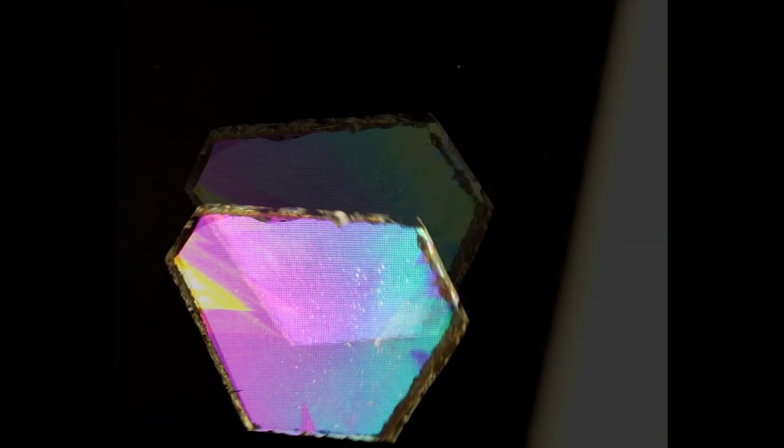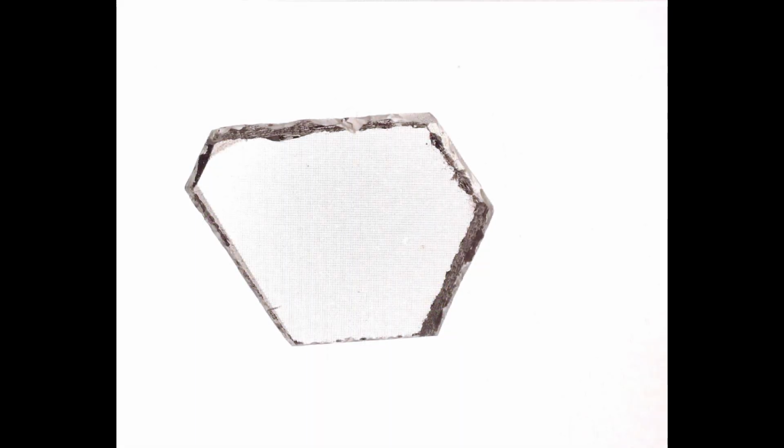Now that we've explored our quartz slice looking down the c-crystallographic axis with crossed polarizers, let's do the same for the view through our crystal looking along the plane of the A-axes. And I promise, the quartz will not be nearly as complicated in this direction. So let's bring in our upper polarizer now, and you can see that in this orientation our quartz crystal is at extinction. And that's because at the moment our plane polarized light is aligned with refractive index omega of our quartz crystal. As we begin to rotate the quartz crystal, light starts to transmit through our upper polarizer.